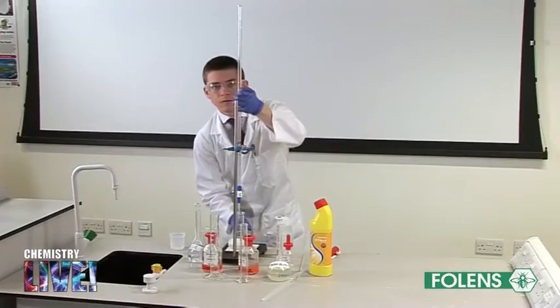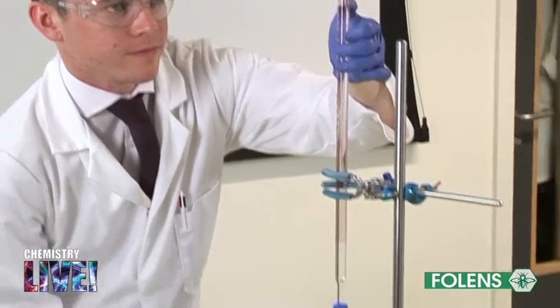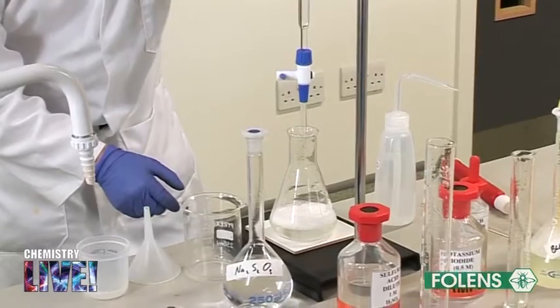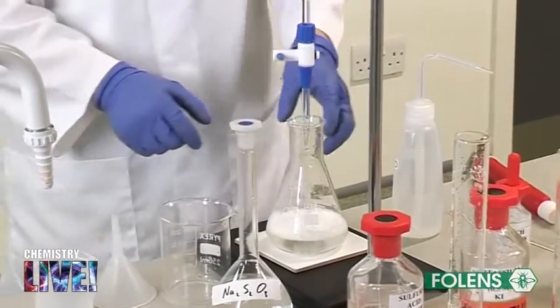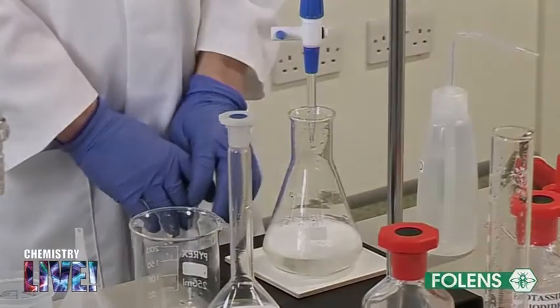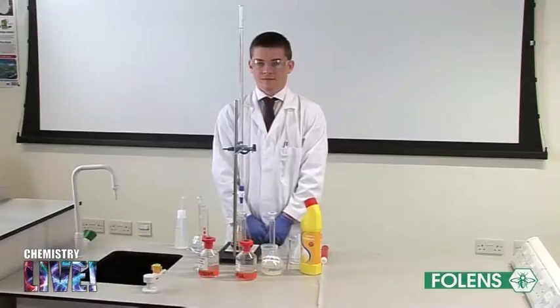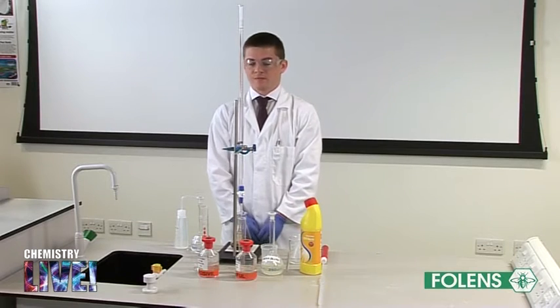Note the titration figure. Perform one rough and two accurate titrations.